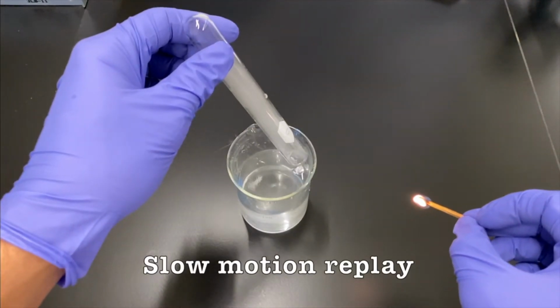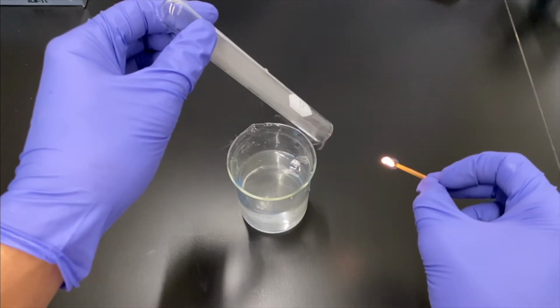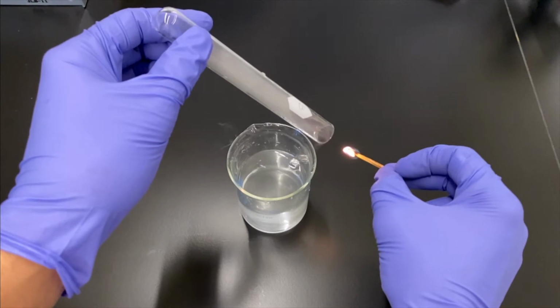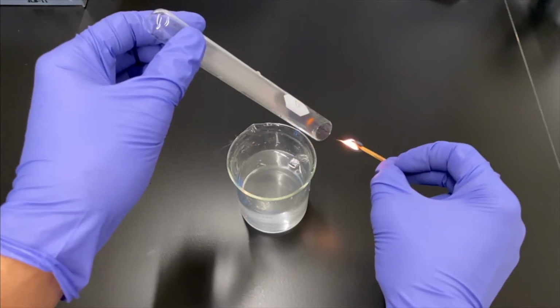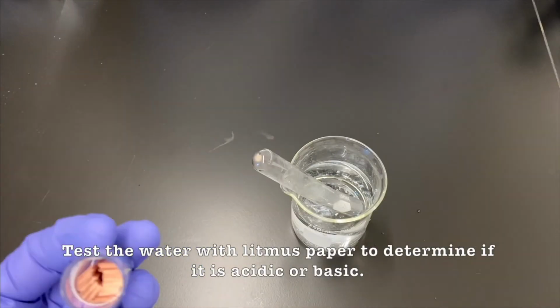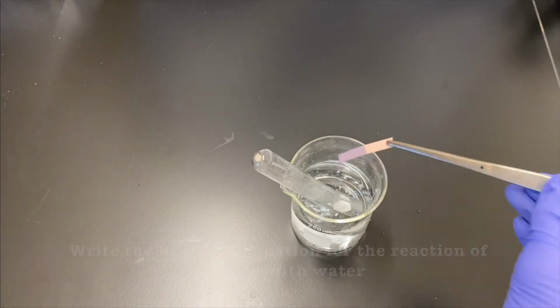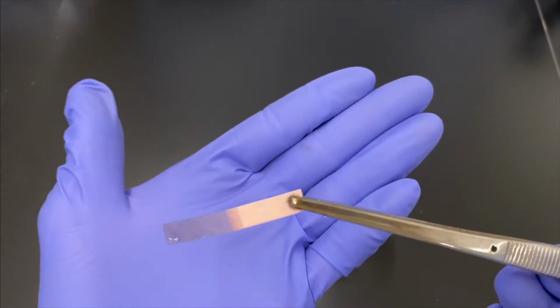And we've got a nice slow replay. But like I was saying, if this is hydrogen gas, that means the water also left behind some hydroxide ions, which is very basic. So if we test the water later and it's basic, that's beautiful. Perfect. And let's test it. So we'll use some red litmus paper. Turn blue. Turn blue, so it's basic. There we go. Water broke into hydrogen gas and hydroxide.